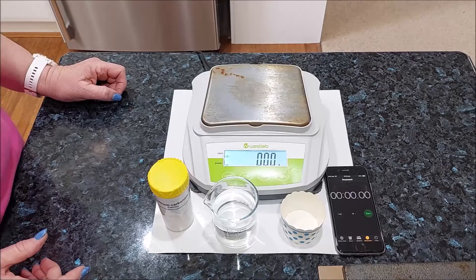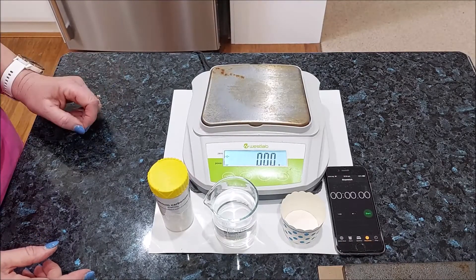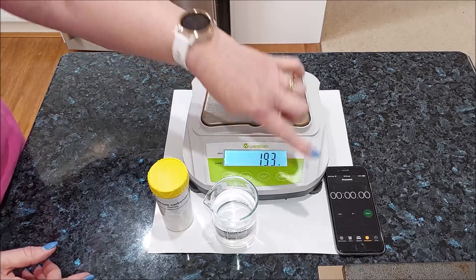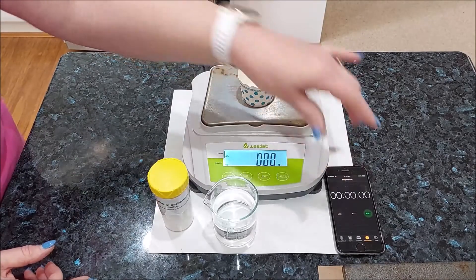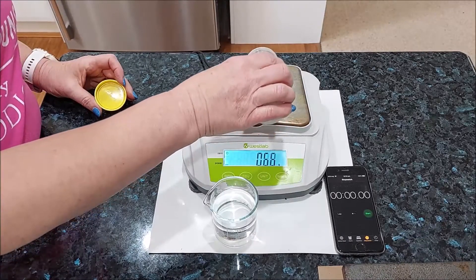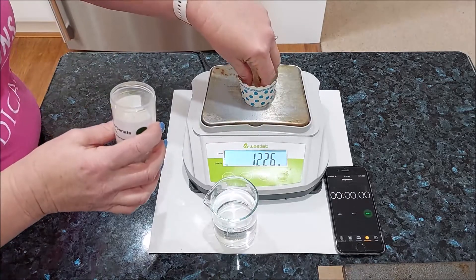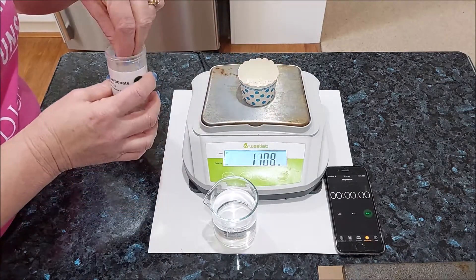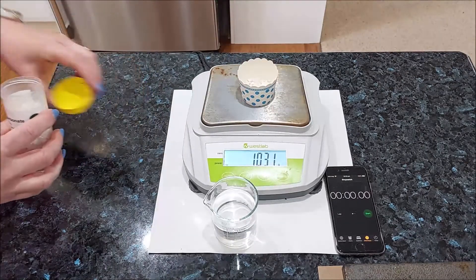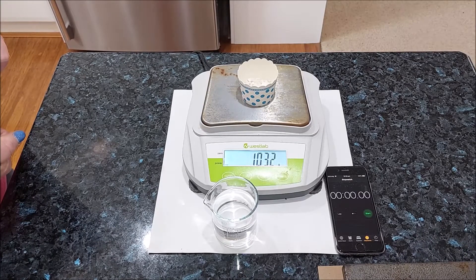I have poured 125 mls of the hydrochloric acid into my beaker and now I'm going to weigh out 10 grams of marble chips. It doesn't have to be exactly 10 grams, just roundabout. That'll do just fine. So let's write down that we have 10.32 grams of marble chips.